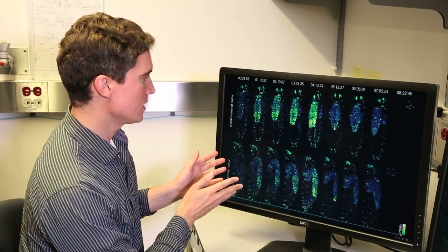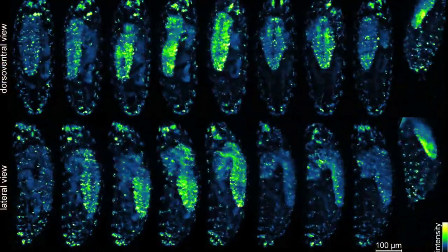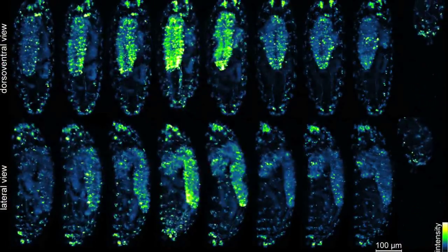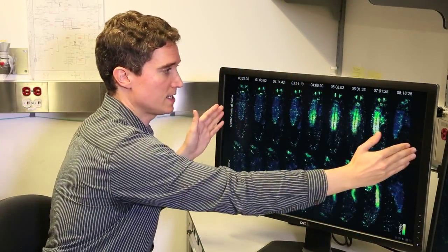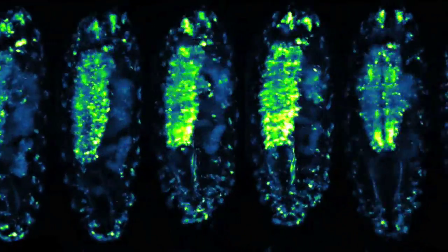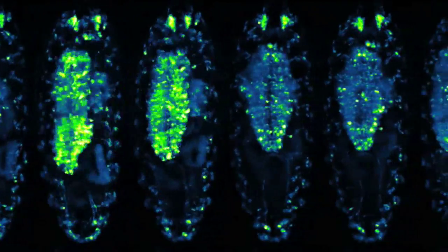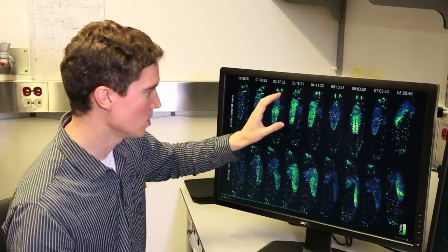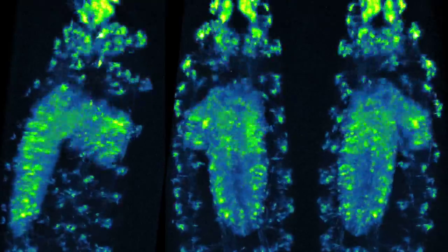We can now use the IsoView microscope to image for the first time a whole nervous system activity across the entire animal, the entire Drosophila larva shown in this video. So in this case, we are looking at a time sequence that stretches across 9 hours of different developmental stages, so that we can follow dynamic changes that occur in the neurons throughout the nervous system while individual behaviors are being produced. So we can correlate the nervous system activity through the behavioral instances that are visible in this video sequence.